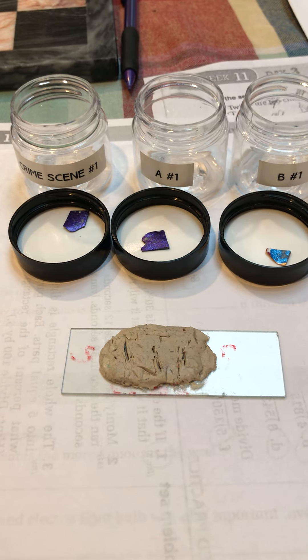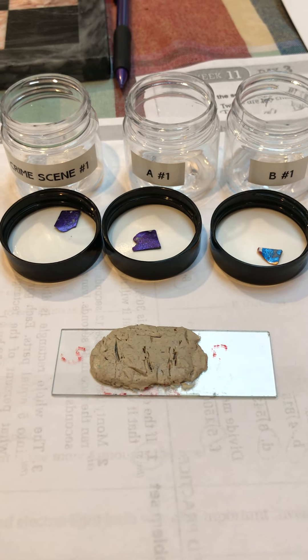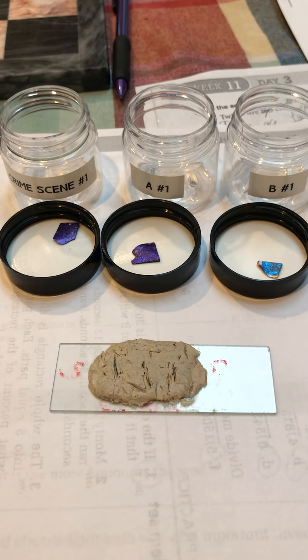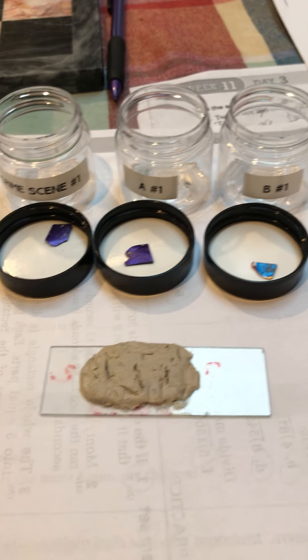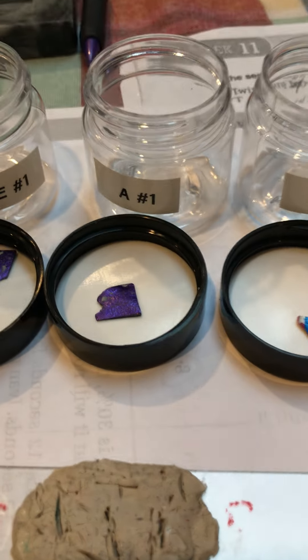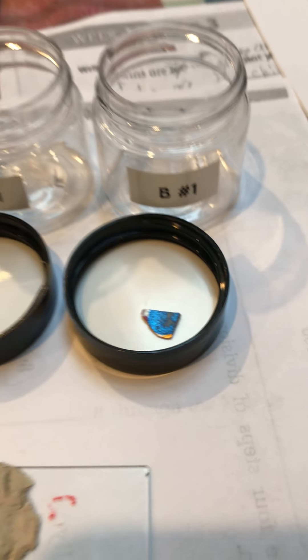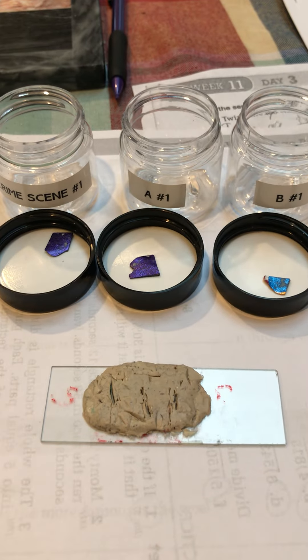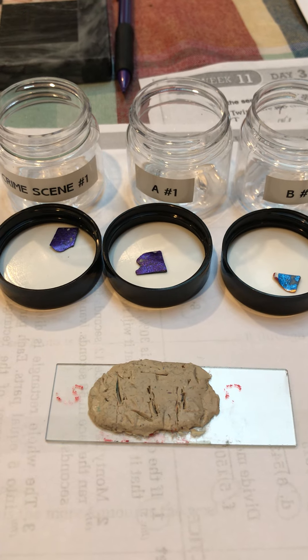All right ladies and gentlemen, today we're looking at paint chips. We've had three paint chips provided: one from the crime scene, one from suspect A, and one from suspect B. What we're looking at today is paint chip layers and layer edges.